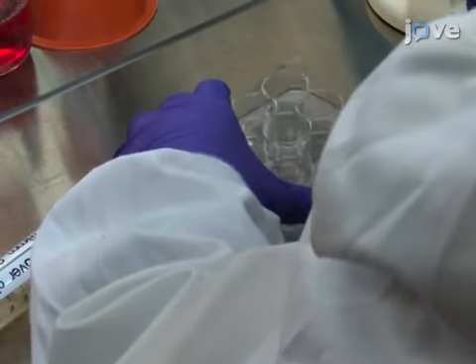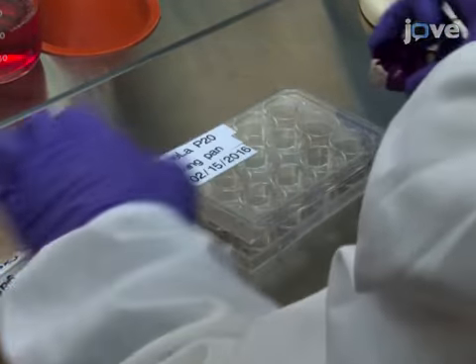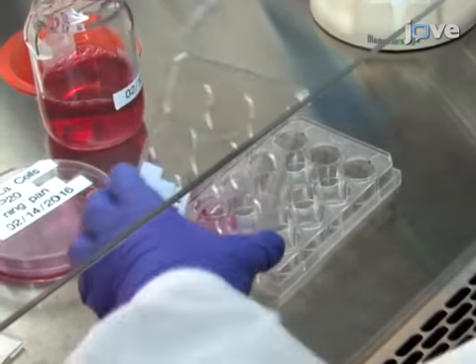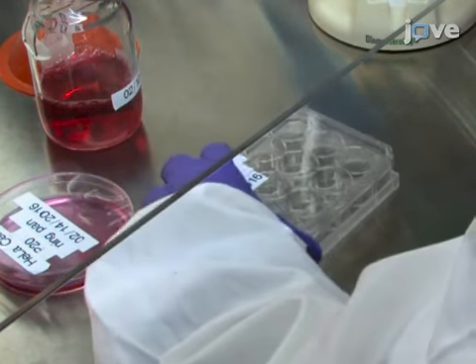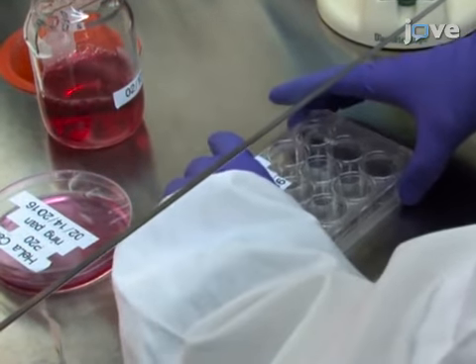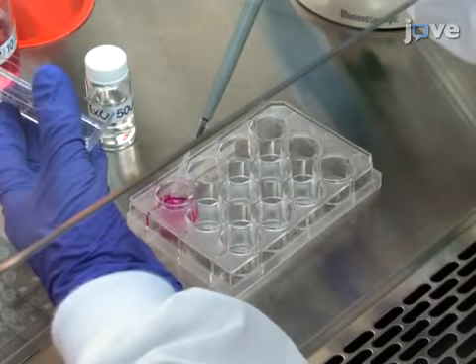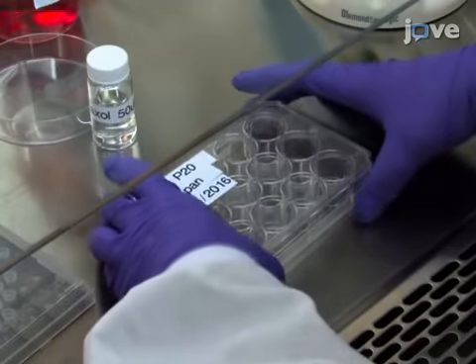To prepare the cell samples for single-cell mass spectrometry or SCMS experiments, first place individual microcover slides into the wells of a 12-well plate. Then, add 1.8 milliliters of cell culture medium and 0.2 milliliters of cell suspension into the well. Gently mix the cells with mild agitation of the plate before incubating in a 5% CO2 environment at 37 degrees Celsius for approximately 24 hours. To perform drug treatment of the cultured cells, add a drug compound solution into the 12-well cell culture plate.